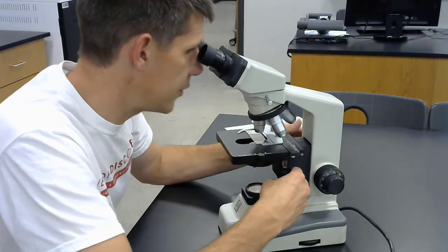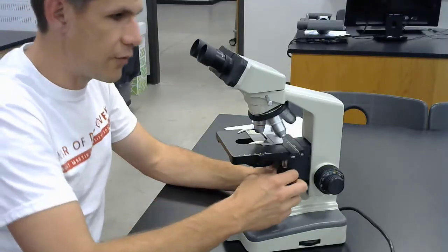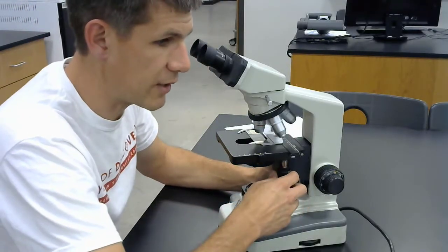Ah, there it is, looks beautiful. I can use these little stage adjustment things to move the specimen to see just where I want to see it.